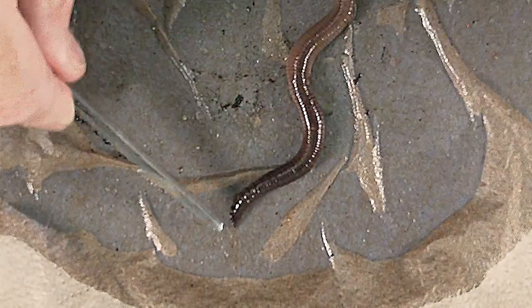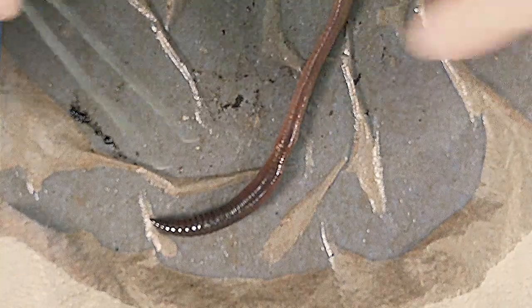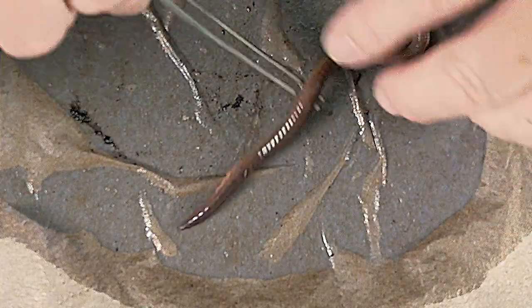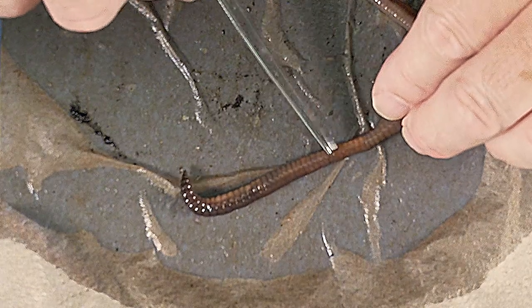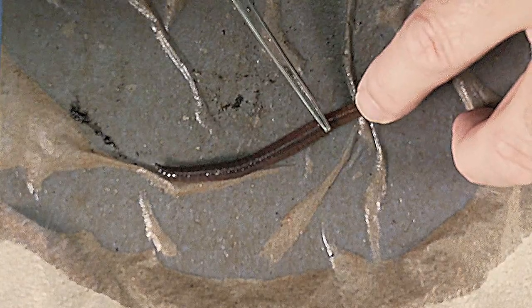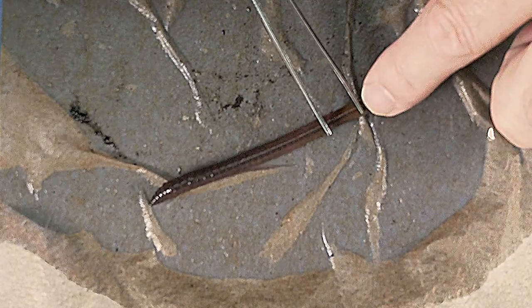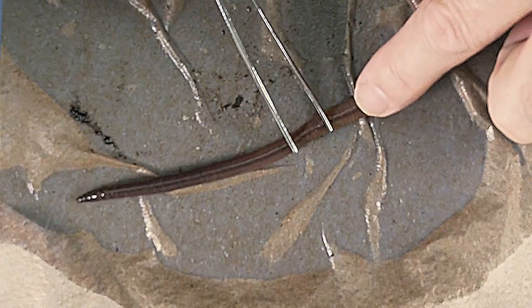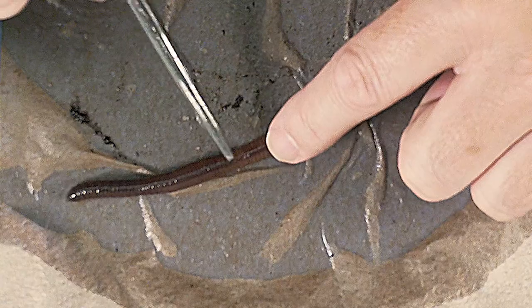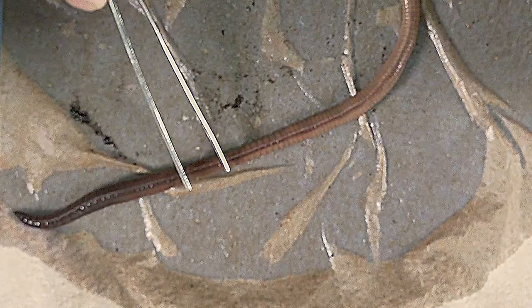This is obviously the anterior end and this is the posterior end. You'll see a lighter region — that's approximately where the clitellum would be. When worms are in reproductive mode, about 30 segments down the body changes a little, and that region is called the clitellum or the saddle. Anterior of the saddle is where most of the internal specializations are found, and that's the region we'll open up during our dissection.